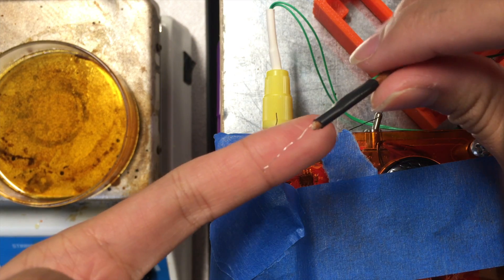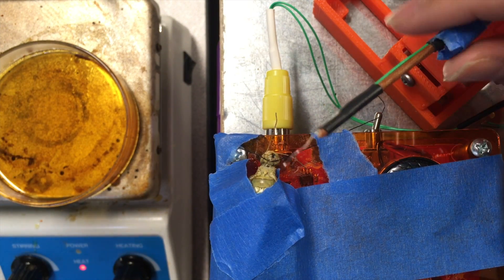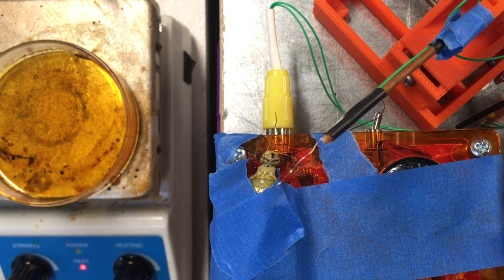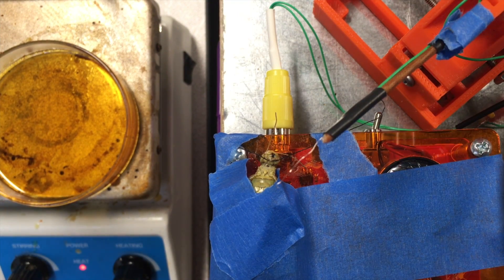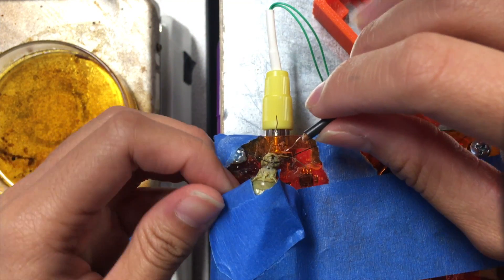This is a hook electrode made from the manipulator electrode, and it's placed in the micromanipulator that can ensure a more precise electrode placement.